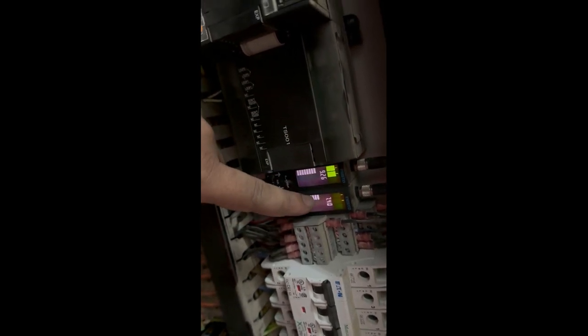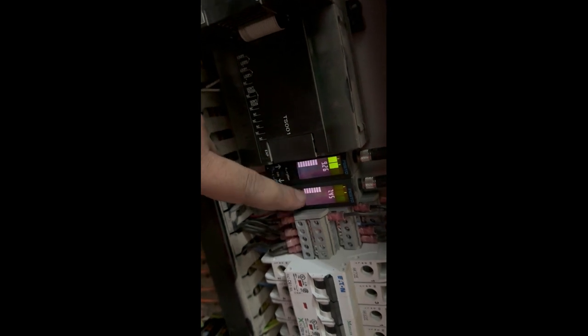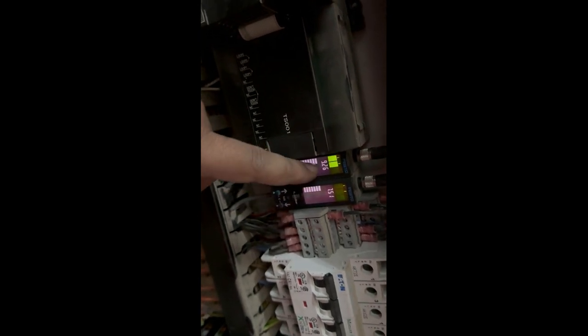And here, neither point A nor point B has been achieved. Once it achieves them, it will again become like this, and it will switch off. So this is the thing which tells your compressor to switch on and off on the basis of this input. This is the input for the PLC, and as the output, the PLC actuates the valves.